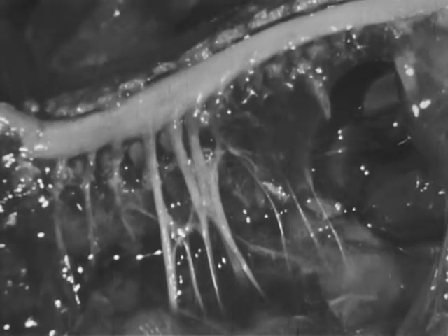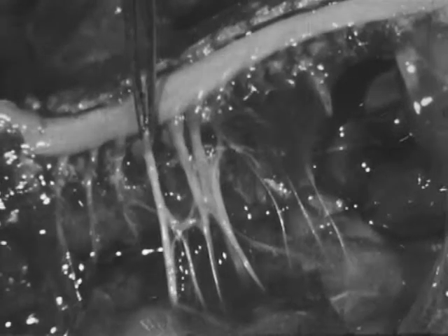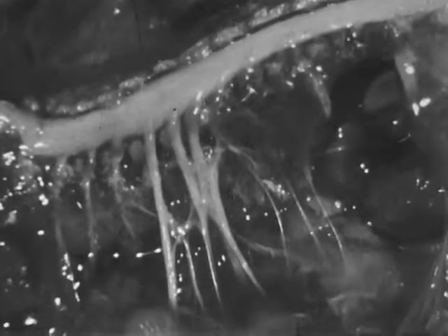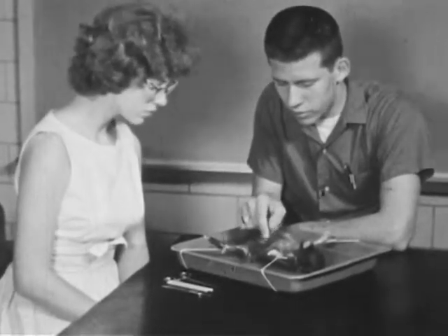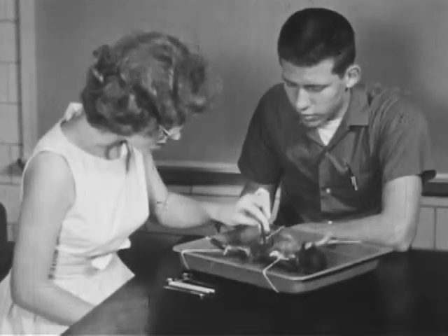Many spinal nerves arise from both sides of the spinal cord and branch and extend to all parts of the body. Through careful study of the anatomy of a mammal, such as the fetal pig, you will learn about the anatomy of all mammals, including yourself.